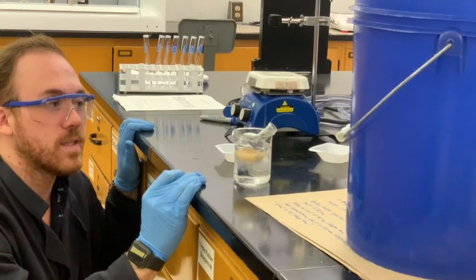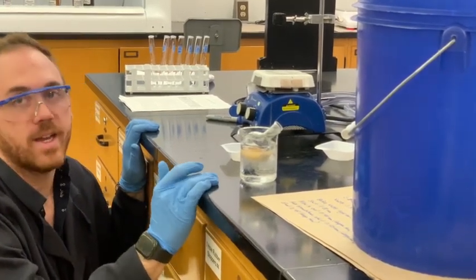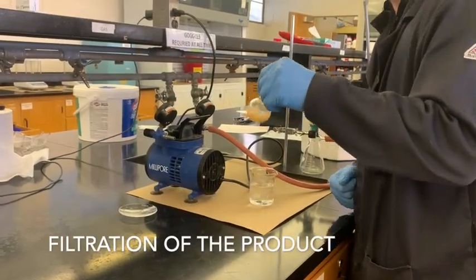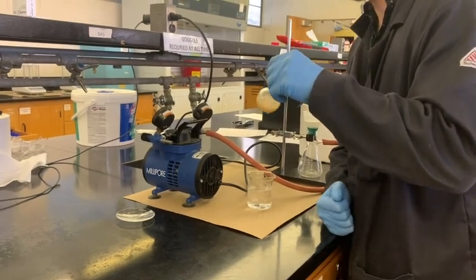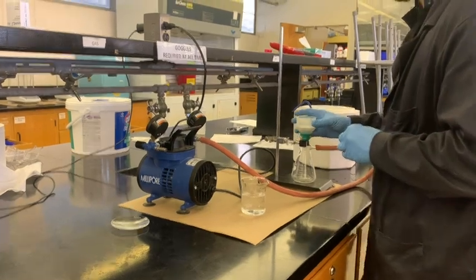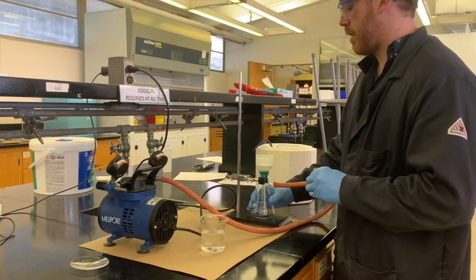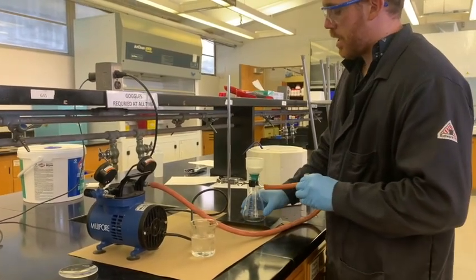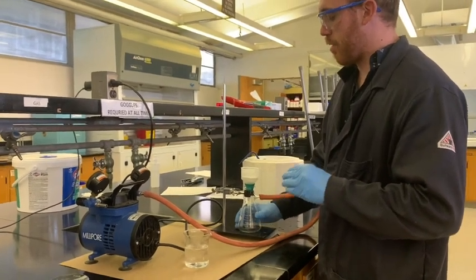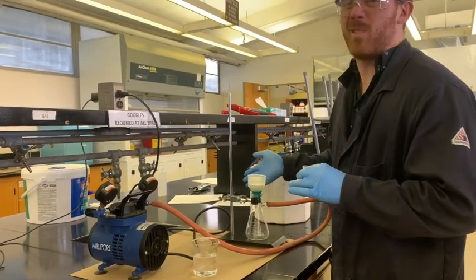What you want to see here is you want to see as much precipitate as possible within a reasonable temperature range. So from here we're going to do a vacuum filtration. This is a Buchner filter. It's got the flat bottom. It's an easy way to remember it. Buchner is flat, and then Hirsch is going to be a cone. Here you're supposed to use a Hirsch, but that's mostly because this is a very fine product and Buchner doesn't always work as well for that. It'll be fine today.